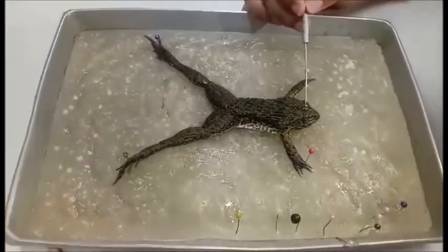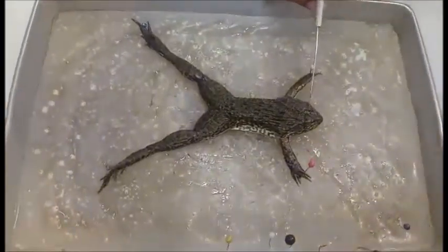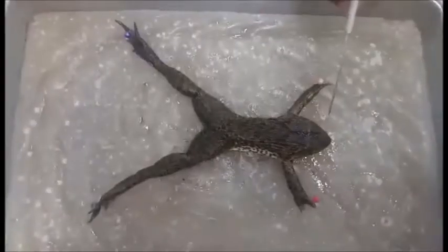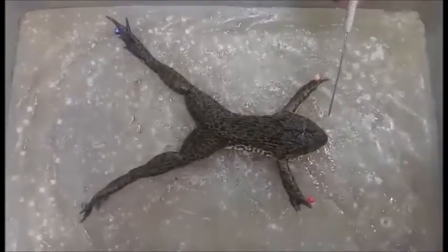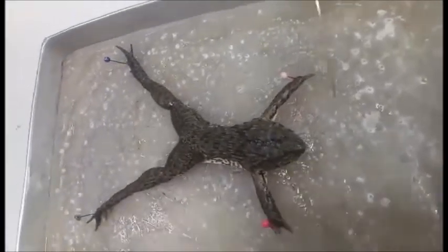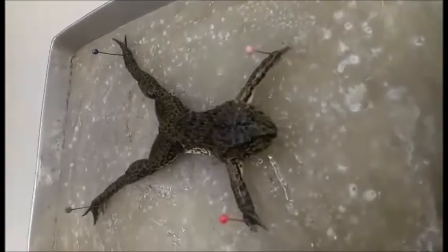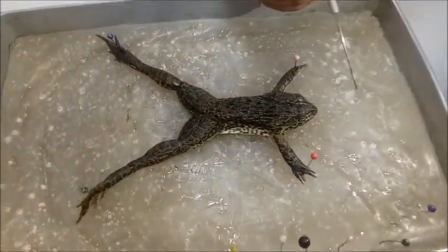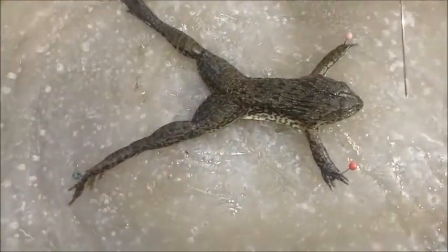After pithing the frog, now let's proceed to the external anatomy of the frog. The external anatomy includes both the dorsal and ventral sides, four limbs, and webbed feet for swimming. The head contains dorsal eyes for sight and the tympanic membranes for hearing. The internal anatomy can be divided into body systems.